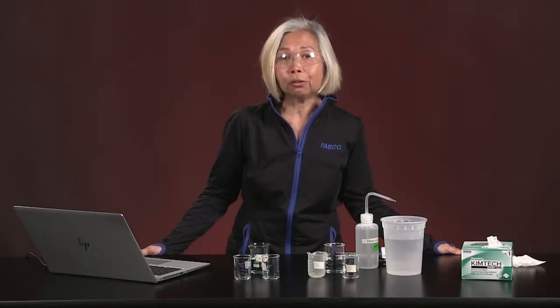As you look at those numbers, I want you to think about which combination, AB or CD, gave very different numbers in terms of their conductivity, temperature, as well as pH. These are important things to understand. Why? If you have a physical change, you will not likely find a whole lot of difference between a combination of one solution and another. That is very different when you have a chemical change that requires the breaking and rearranging of bonds. Now, it's your turn.